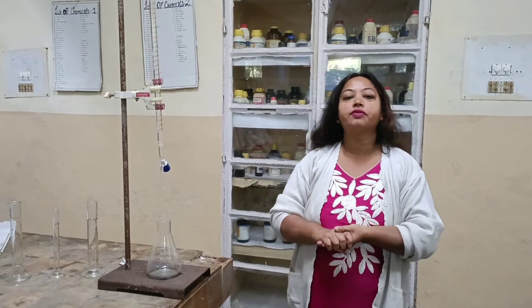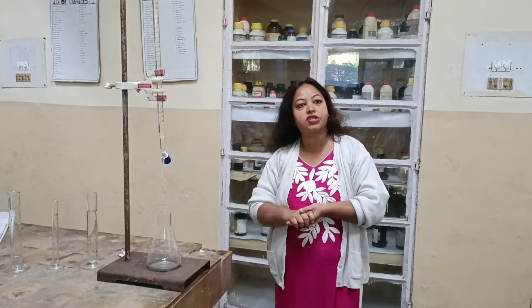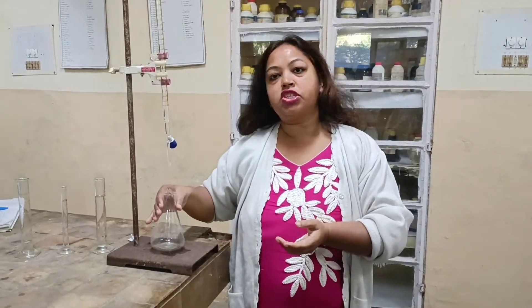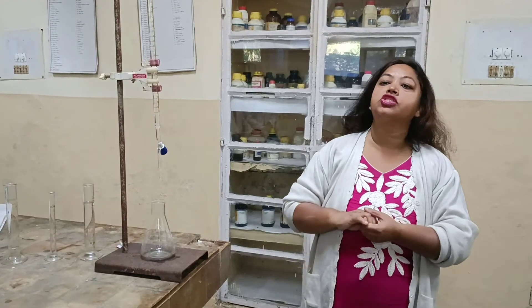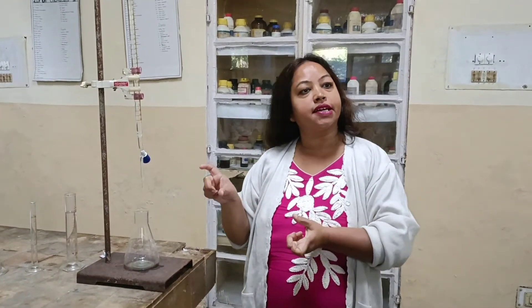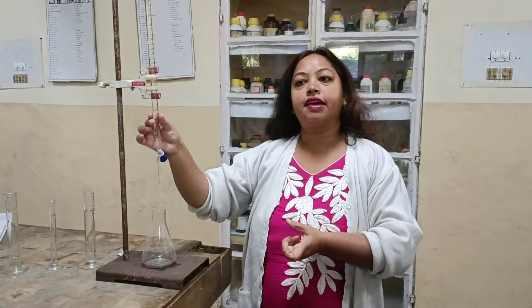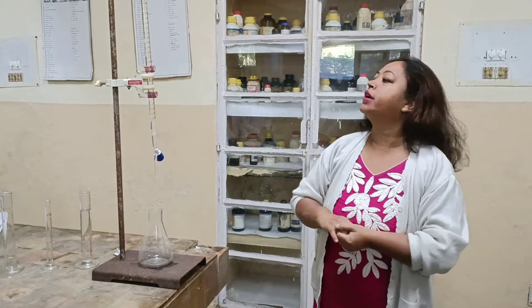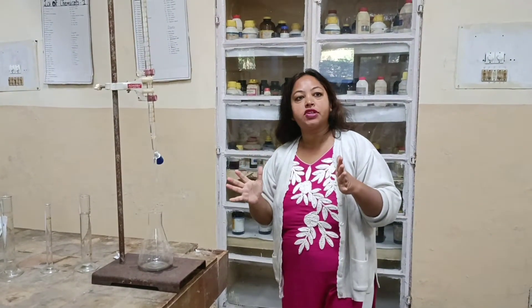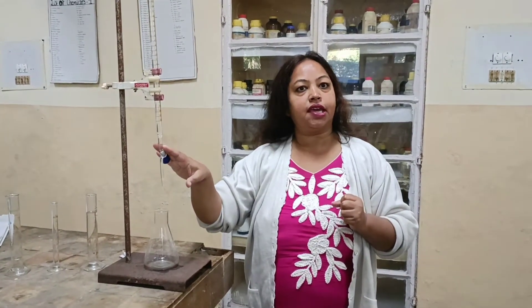Good morning students. Today we will study complexometric titration. This is a titration in which the metal — which is our calcium gluconate salt — and the metal in that salt is calcium, will form a complex with EDTA, which is our complexing agent or chelating agent. So what happens in complexometric titration is the metal forms a complex with EDTA.